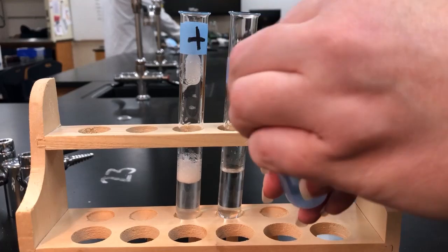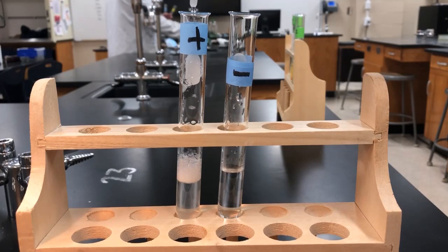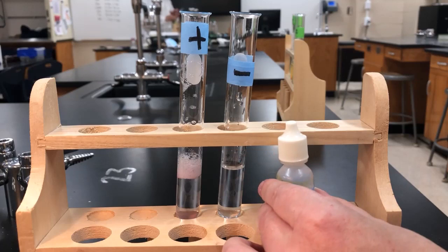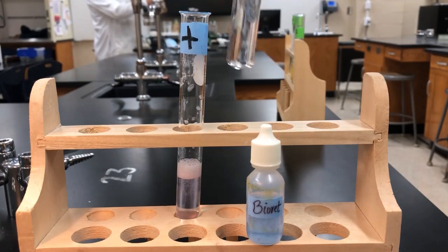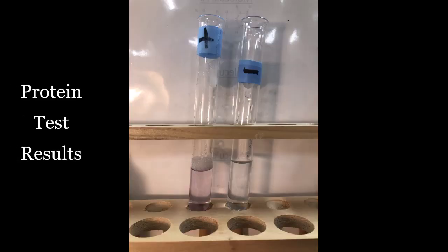To test for protein, we use a solution called biuret. And just like we did with the iodine solution, we're going to drop our indicator solution into the test tube, and we are ultimately looking to see if there is a color change. So just like we did with Lugol's iodine, it is a good idea to make sure that you have swirled that test tube around and make sure all of the biuret solution is distributed into the food that you're testing. Our positive result on the left shows a light purple color, and our negative result on the right shows a light blue.